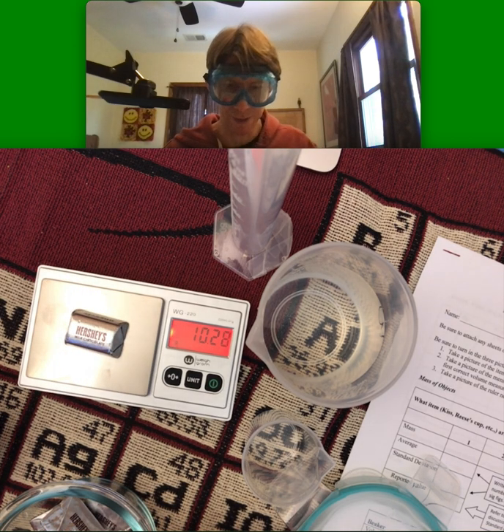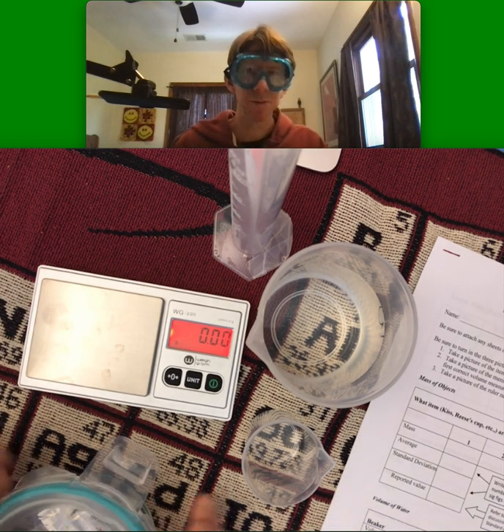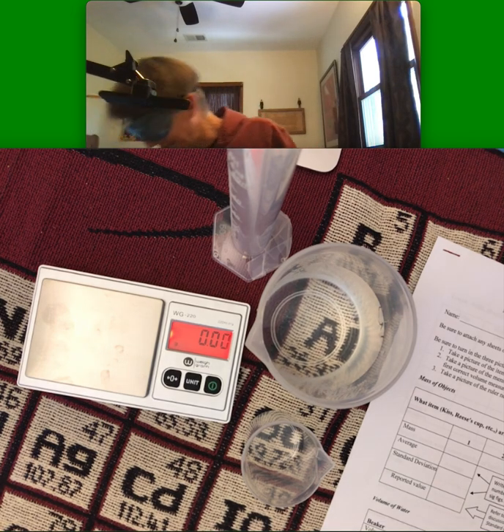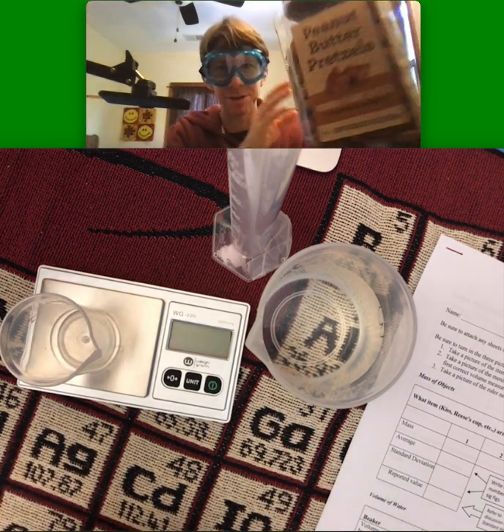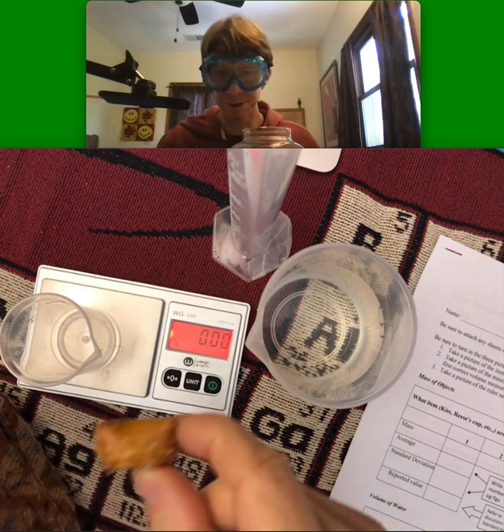You can see that each of them is about 10 grams, although I will end up putting them in beakers when I do the actual lab. For this, I've got some peanut butter filled pretzels. They work well. I can put one of those on here.